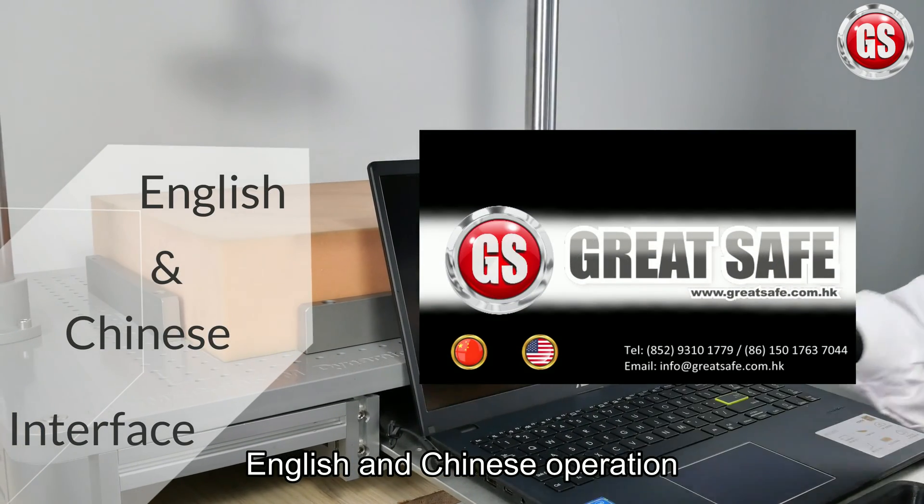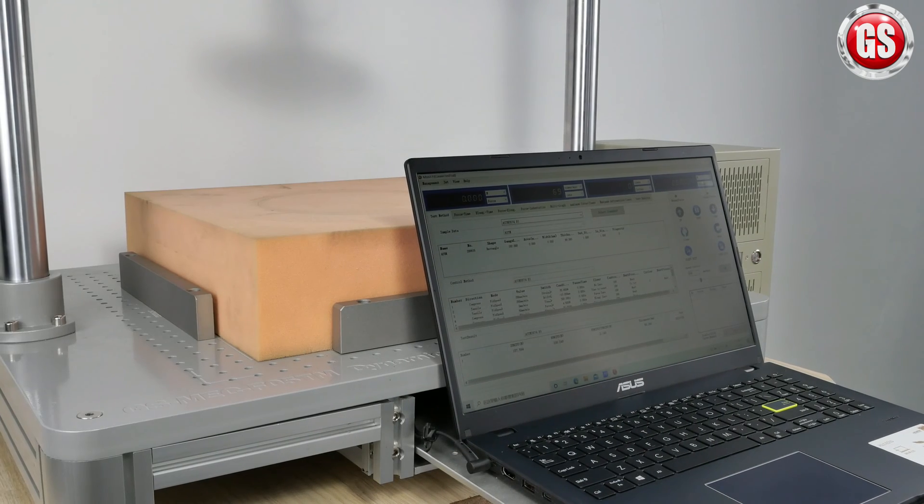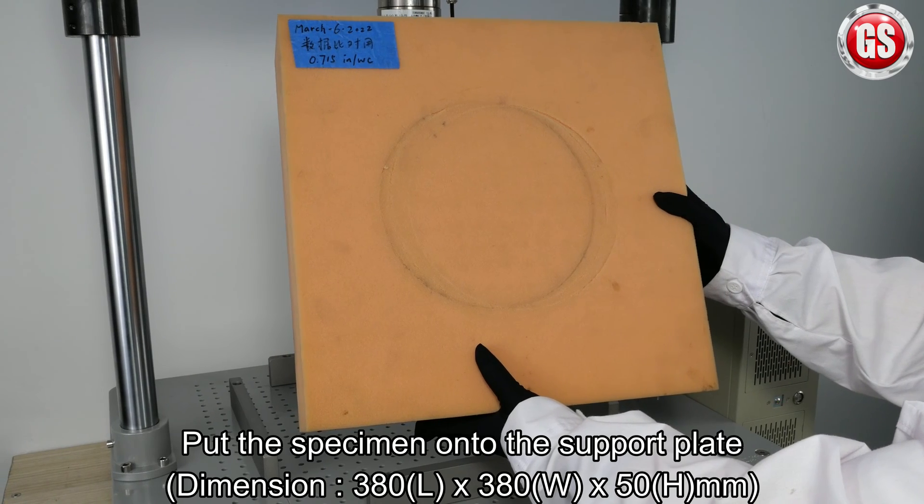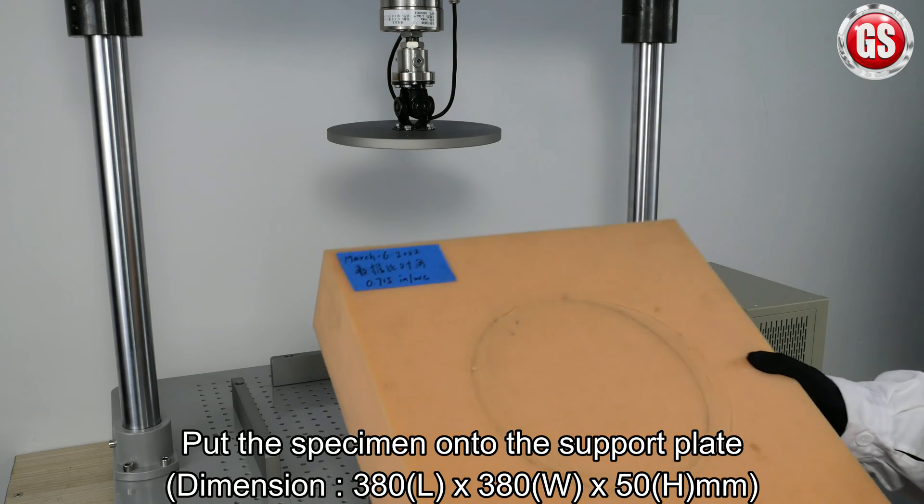Our smart control system has English and Chinese interface. First, put the specimen onto the support plate.